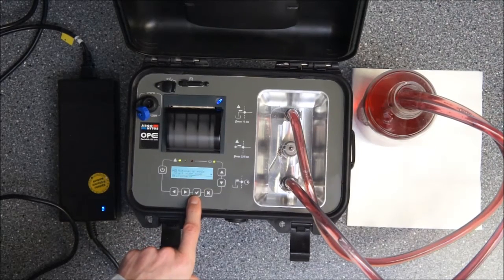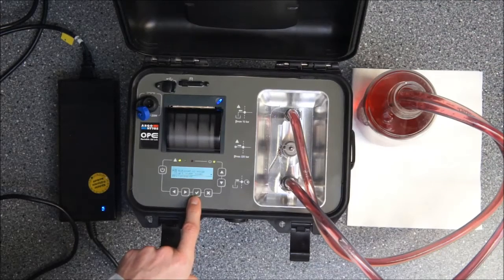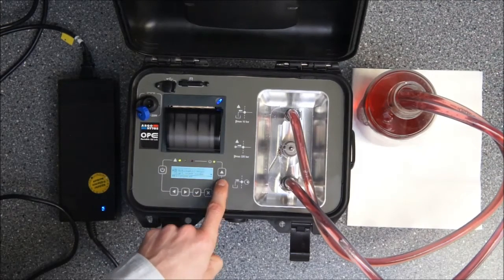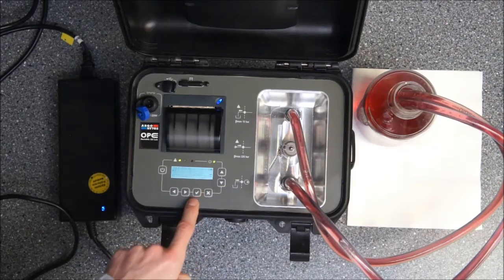Now the measurement will be done repetitively with the settings according to flushing time, measurement time and pause time that we have chosen before. I just choose the pump mode right now.